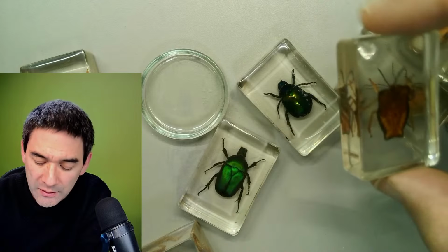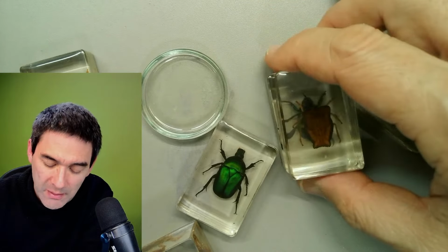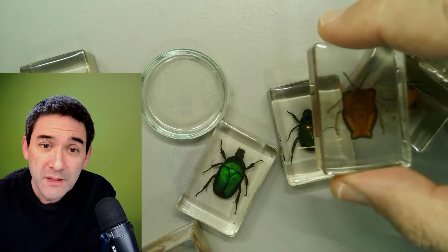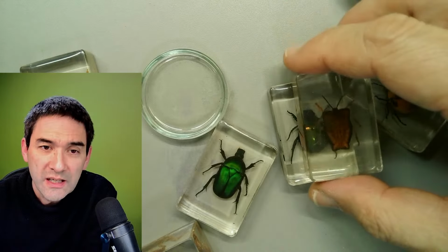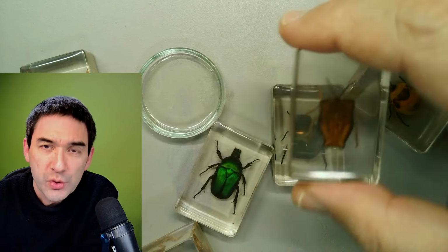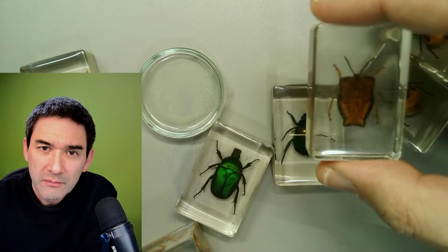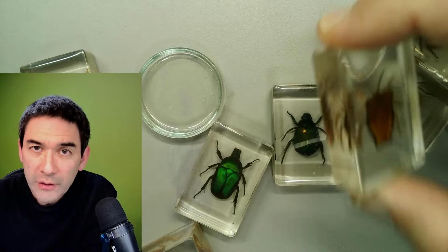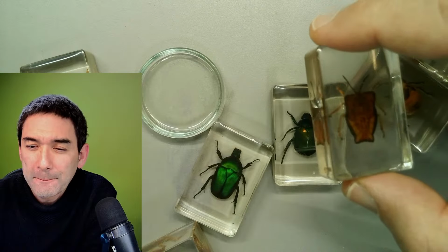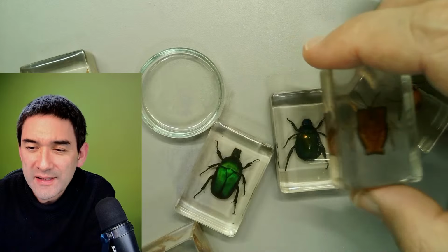Right, and dehydrated. I can imagine that that's one of the reasons why those insects are maybe easier to make than other specimens, because of their solid exoskeleton. They do not shrink so much, and their shape is quite well preserved. But other organisms, when you dehydrate them, shrivel up and shrink and deform and so on.